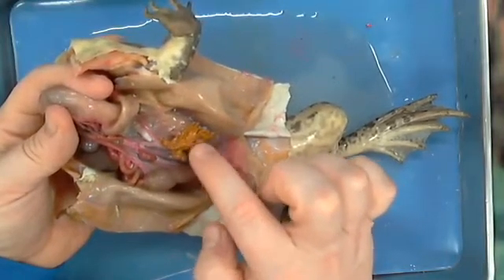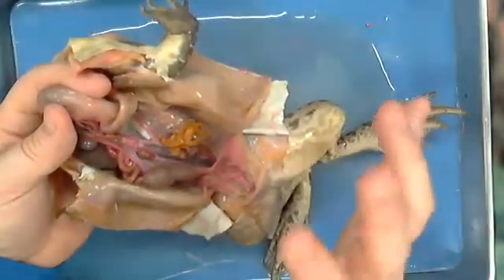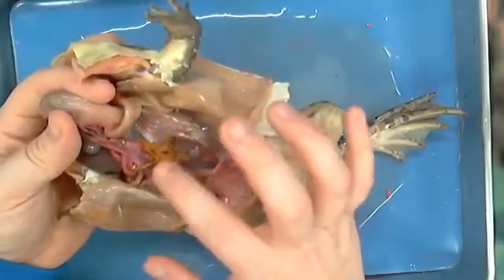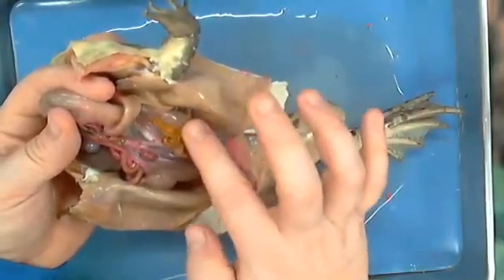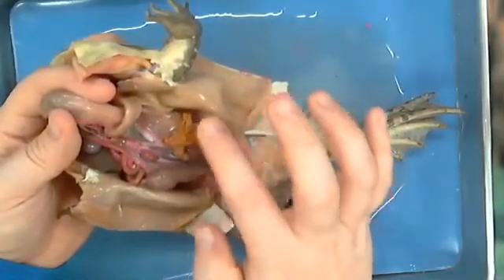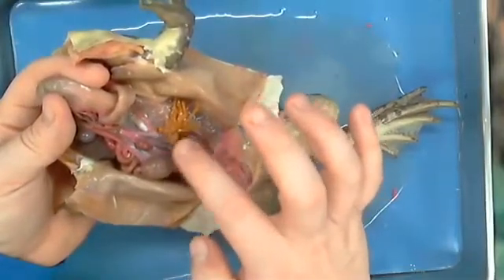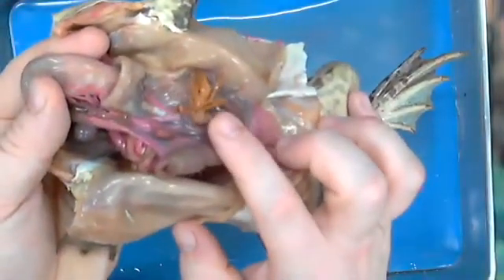All right, so this is what we call a fat body. So these are fat bodies. Some frogs have more of them. It's basically their storage for energy. They have these long tentacle-like looking things, and they'll be all inside of them. He doesn't have a whole bunch of them, okay? So thankfully, we don't have to worry about that. But this is what we define as fat bodies. You'll have to know that. This little bead that's here on it is part of the fat body, okay? You can kind of see the bead right here with my finger.